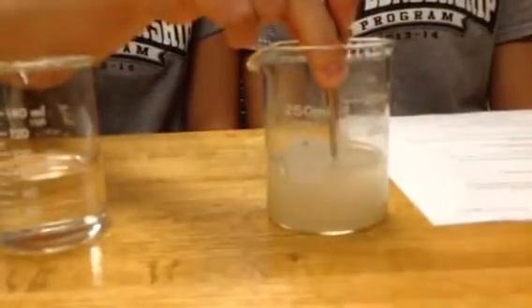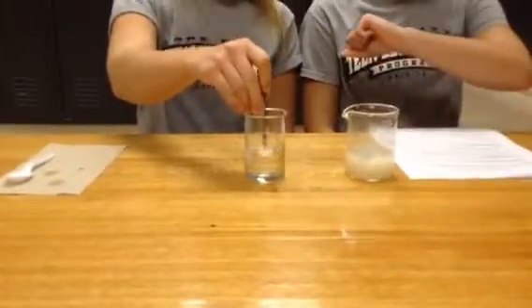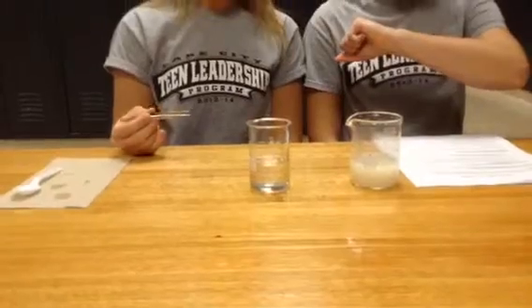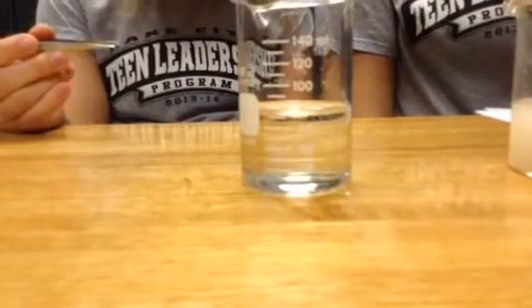So we will show you how that's done. So 1, 2, 3, 4, 5. Blot it off. Go. 1, start. 2, 3, 4, 5, 6, 7, 8. Stop. 8.3 seconds. So we will take 1 divided by 8.3 seconds, or 1 over 8.3 per second, to find the rate, which is per second.